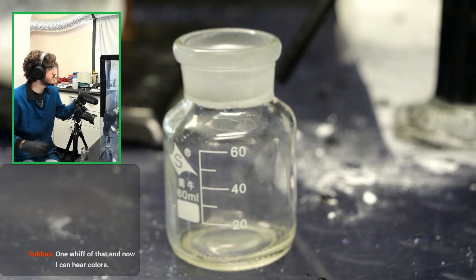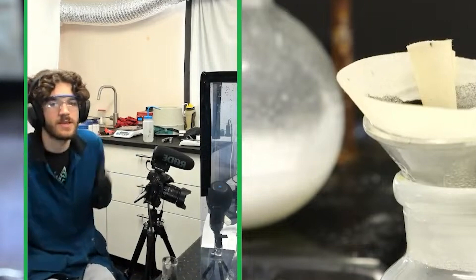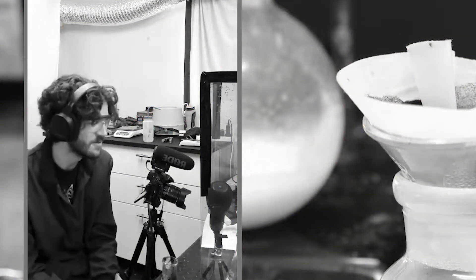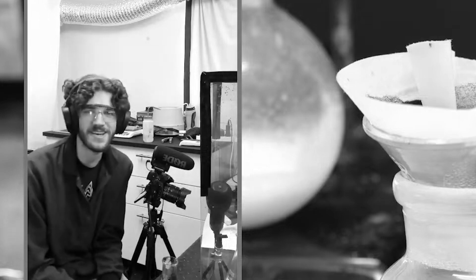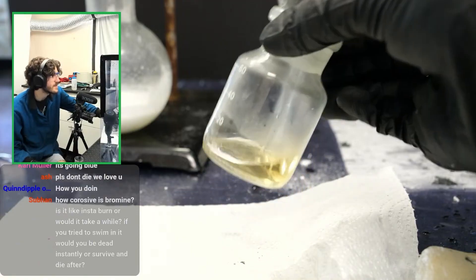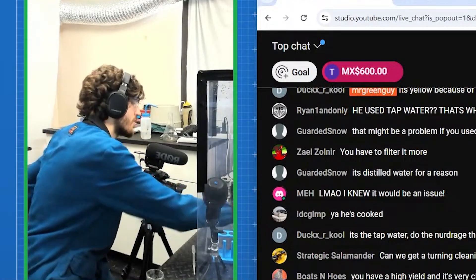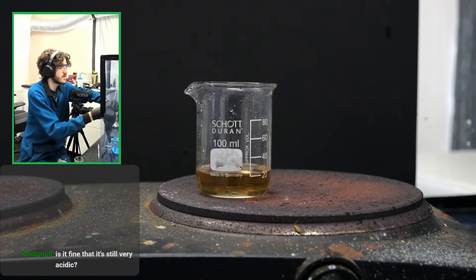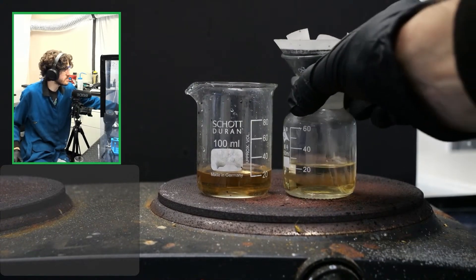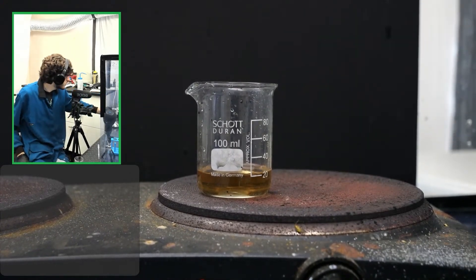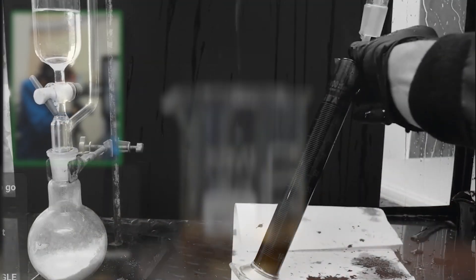It's going to be low yields because I exploded majority of it. I mean, it's better than filtering a hundred milliliters. Maybe it's a good thing we exploded all of it out. So we don't have to deal with too much. It wasn't going to work anyway if I didn't explode it. Yeah. Like it's yellow. Why is it yellow? Yeah. His is kind of pinkish. I'm going to have to do a praying hope method here. This is the hydrochloric acid solution, by the way. The other one is still sort of filtering out. It's a lot cleaner looking, but less concentrated probably because half of it got exploded out of my fume hood.